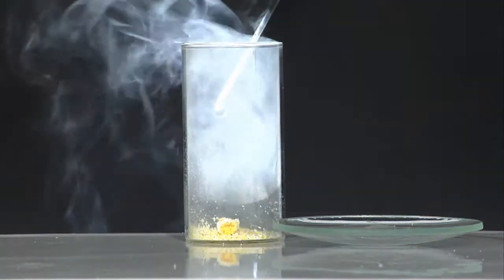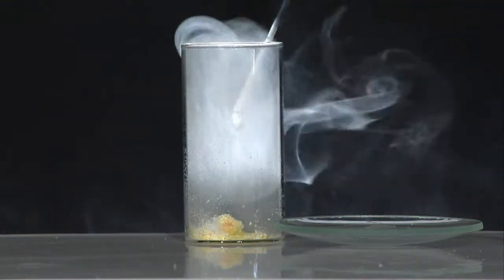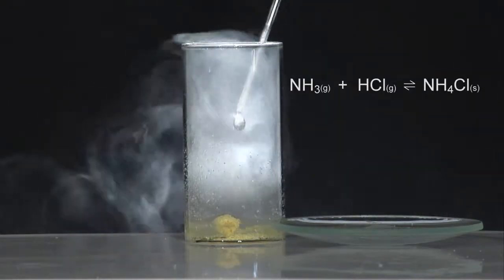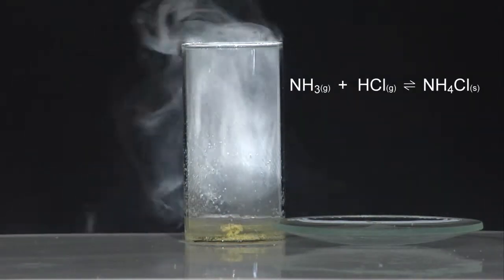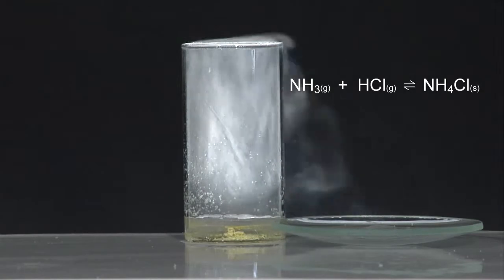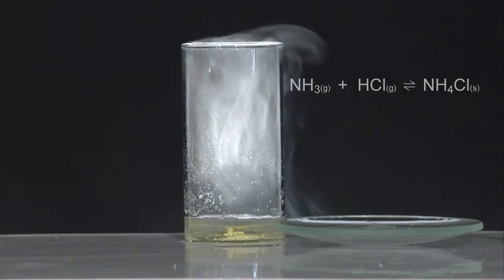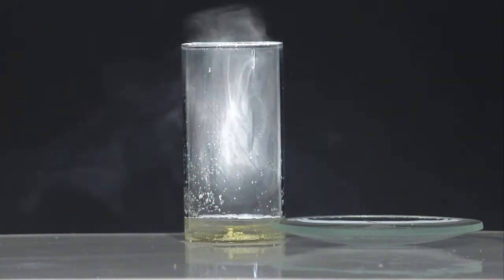The hydrolysis of the aluminium chloride forms hydrogen chloride vapor, which reacts with the ammonia vapor, forming a smoke of solid ammonium chloride.